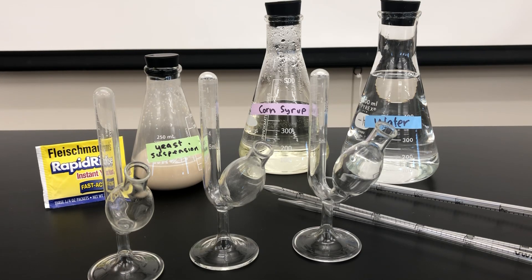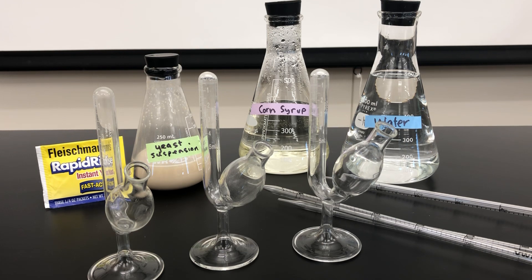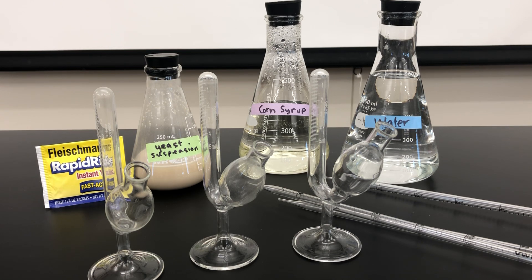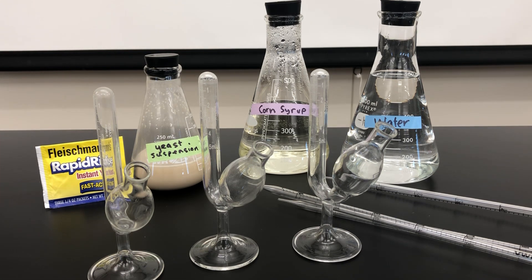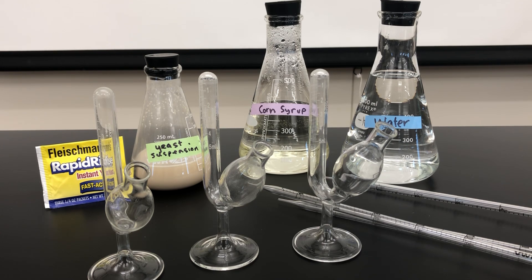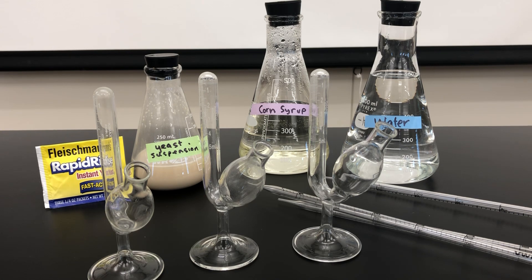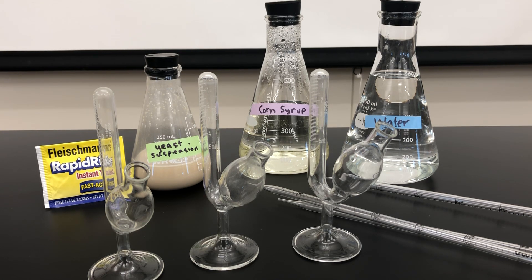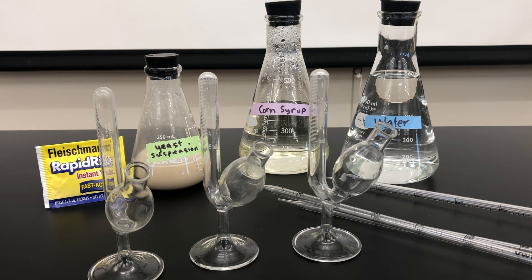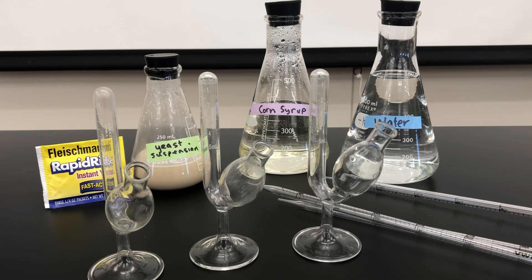Lab topic number five investigates ways to measure both anaerobic and aerobic respiration. In exercise 5.1 we're going to investigate anaerobic, also known as alcoholic fermentation. We'll be using rapid rise yeast in combination with corn syrup and water to estimate the fastest rate of respiration. If you look at the formula on the bottom of page 101, you'll notice the products are alcohol, carbon dioxide, and ATP.